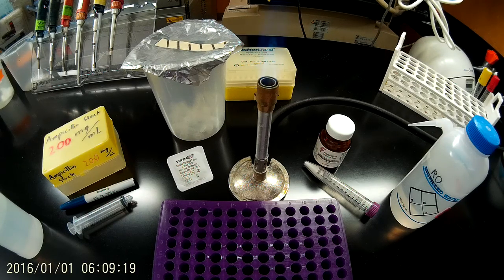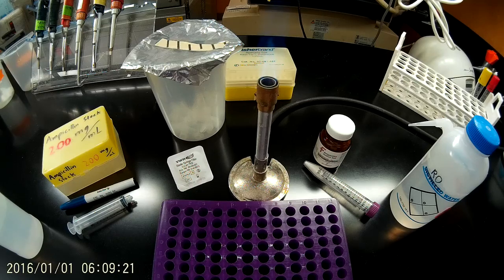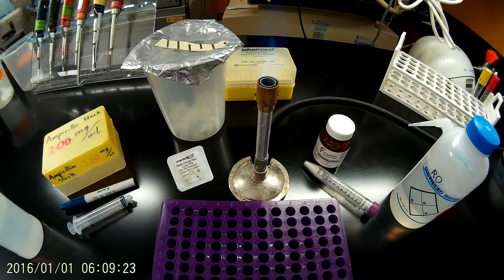Hello everyone. Today we're going to learn how to prepare sterile ampicillin stock solution. If you're watching this, you probably already know that ampicillin is one of the most common selection antibiotics.